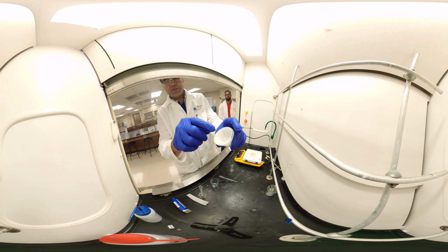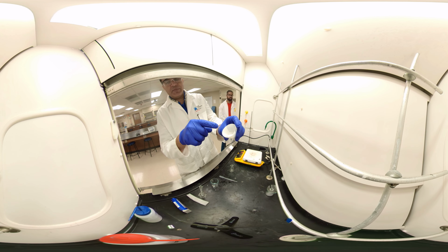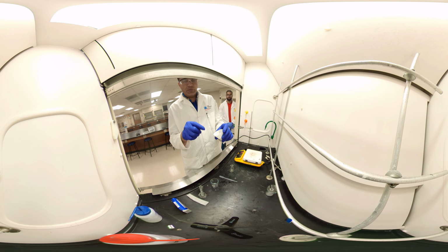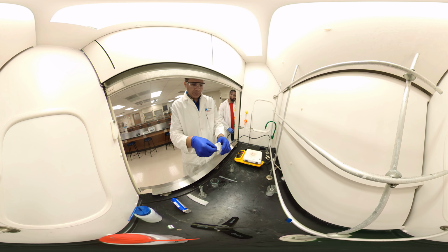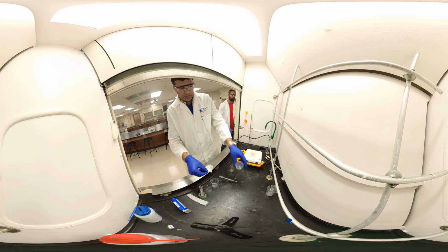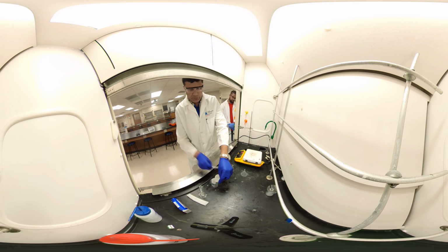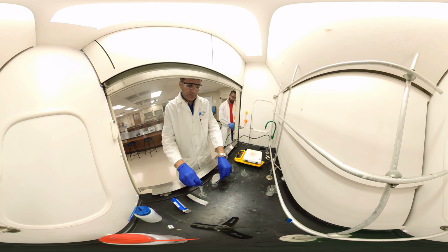I have a solid in the filter paper. This is binder and acetaminophen. So we are going to dissolve it in ethanol and warm it up. Acetaminophen will dissolve, binder will remain there, and we'll filter it again. Okay, let's go ahead and do that. So to transfer, I put the funnel on the side. I just open the filter paper and transfer to the beaker with 6 milliliters of ethanol slowly.